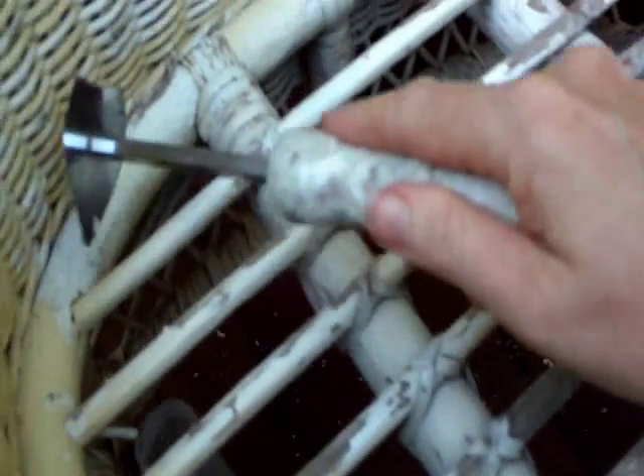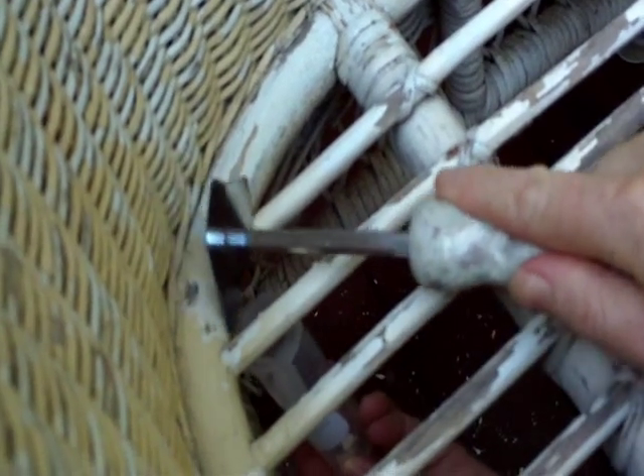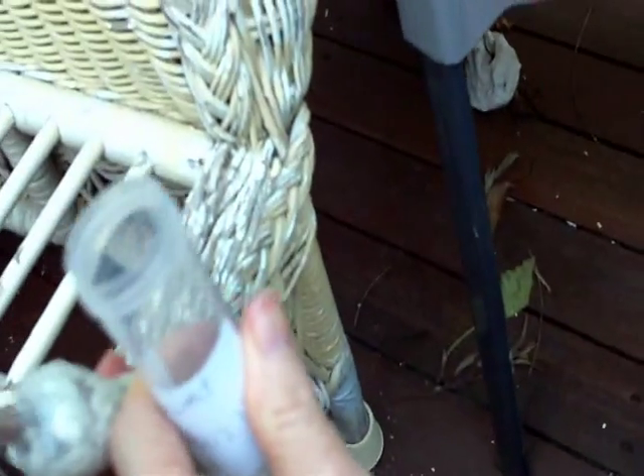We've got enough paint. The older layers of paint are the ones to be most keen to pick up because they're more likely to be leaded. But actually all of the paint layers here look pretty old. This family has the excellent habit of leaving shoes at the door, so I will also leave mine at the door.